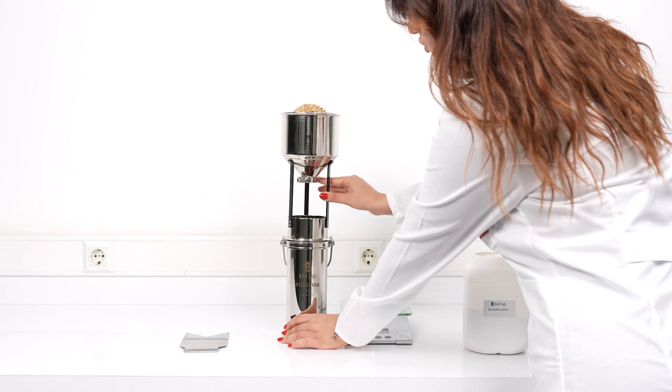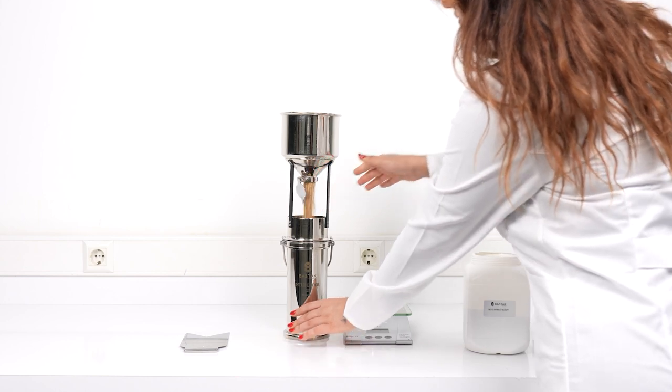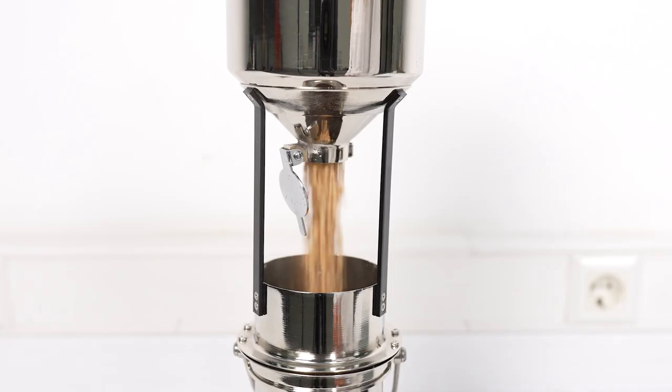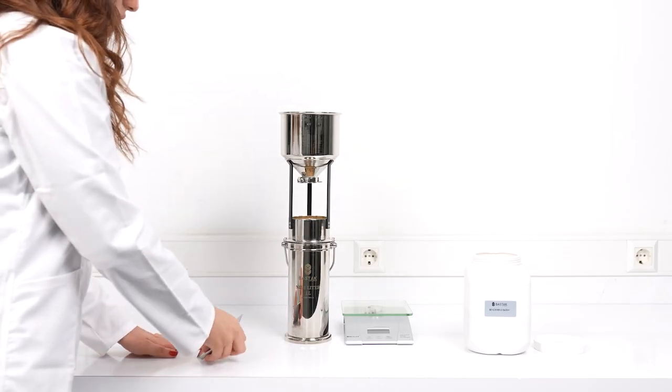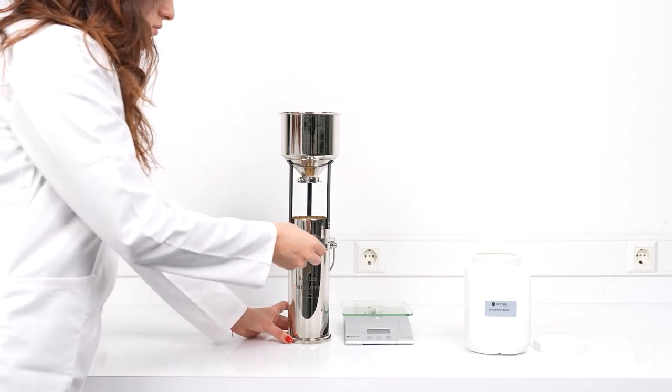The magnetic lid at the bottom of the filling container is manually opened. The homogenized sample to be analyzed is poured into the measurement container. The knife with the sharp side up is placed into the groove on top of the measurement container.